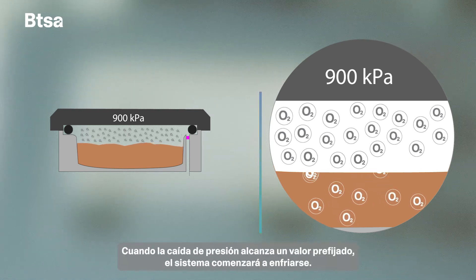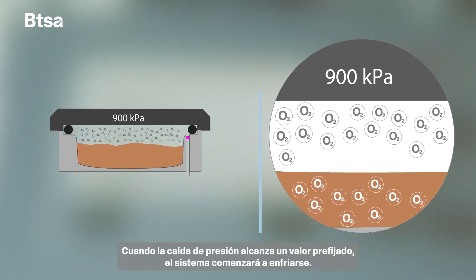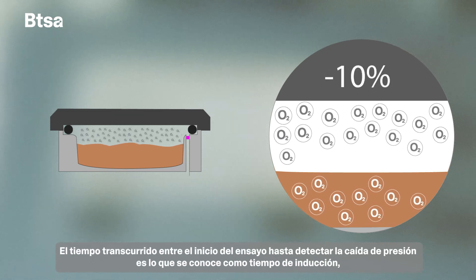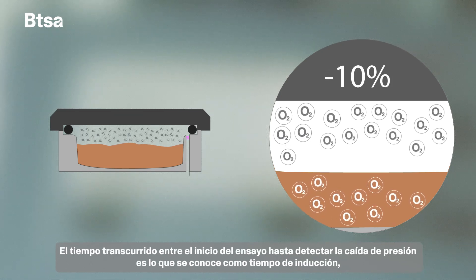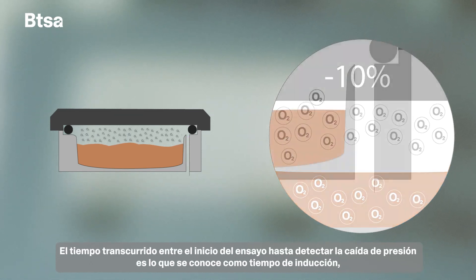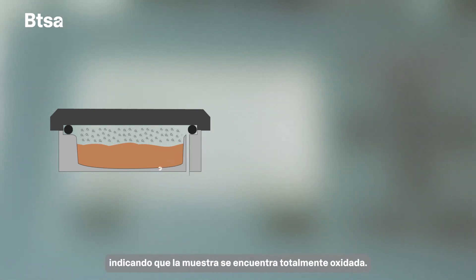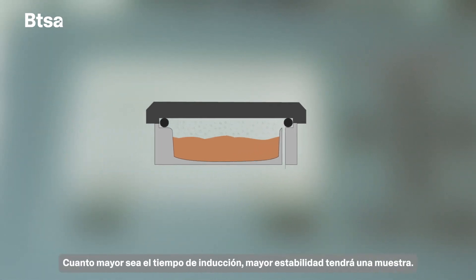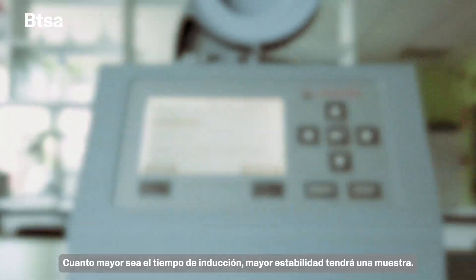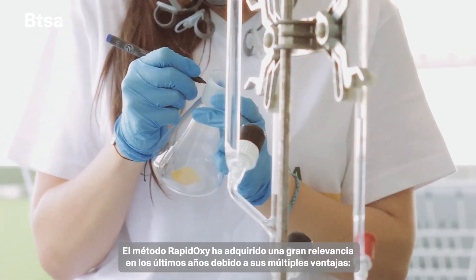As the sample becomes oxidized, the oxygen pressure in the chamber decreases. When the pressure drop reaches a preset value, the system will begin to cool down. The time elapsed between the beginning of the test until detecting the pressure drop is known as the induction time, which indicates that the sample is totally oxidized. The longer the induction time, the more stable a sample will be.